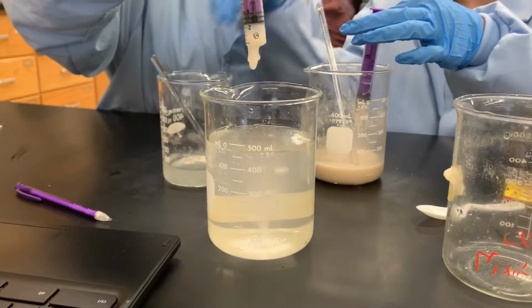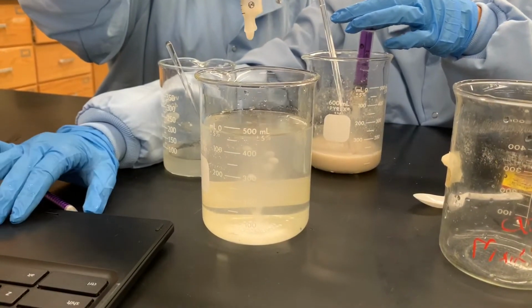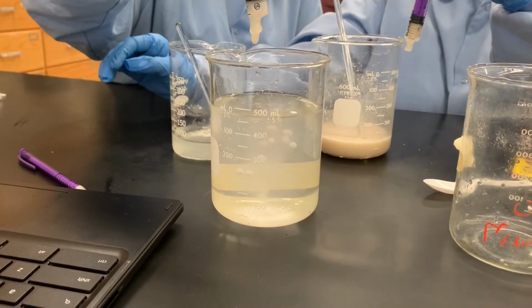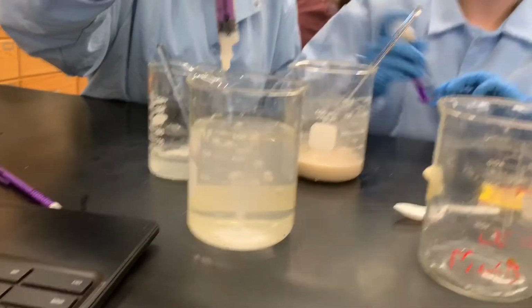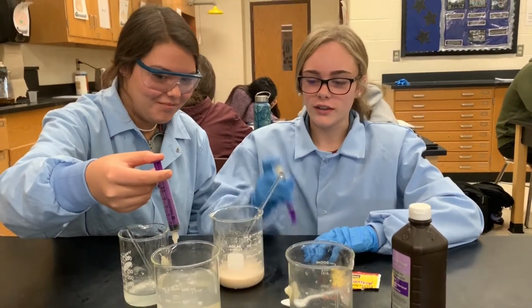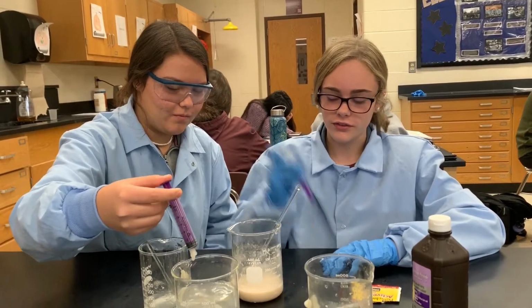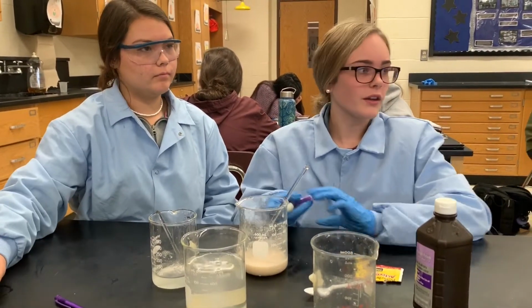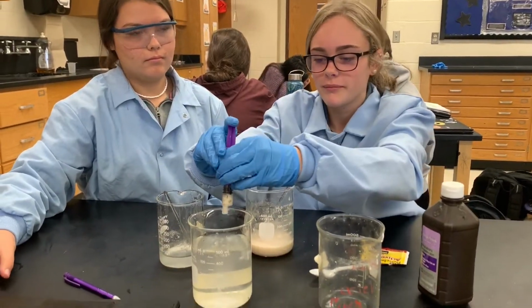The calcium chloride makes an outside shell around the spheres. This is because the yeast and alginate react with the calcium chloride, forming the outer shell, which creates a lining to keep the liquid inside the spheres enclosed. The spheres will set quickly, so be careful when handling them not to pop them.